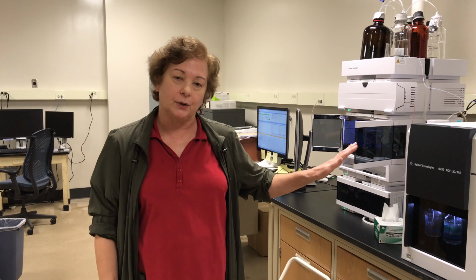Besides the ESI TOF accurate mass instrument, we also have a GCMS instrument that's available for your use, and again, you could become a user of that instrument as well. We have other instruments. My colleague Fabrizio will be explaining those to you, I'm sure. Feel free to send out any questions you might have.